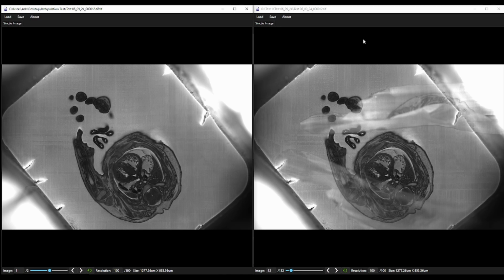Other situations may be if you've restarted an experiment and there's a big difference between two sets of data that you have. Another example would be if the environmental changes, such as the lights have been turned off for a section, or your hand was in the way of the objective. The idea is that you've not lost this section, you're able to recover it digitally from the left and the right of the original image.